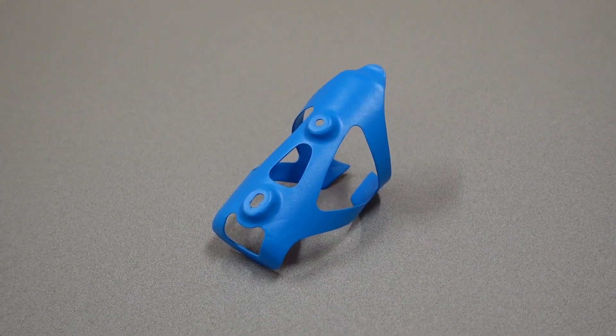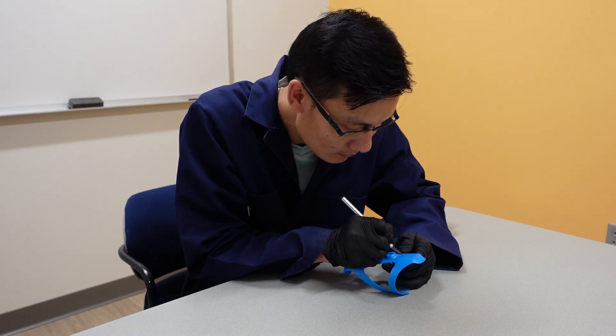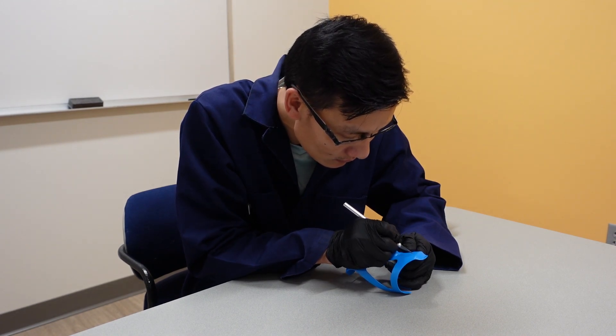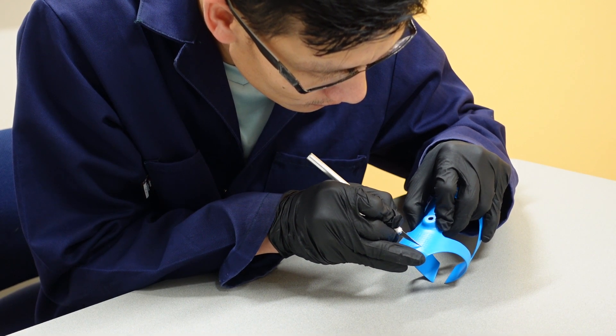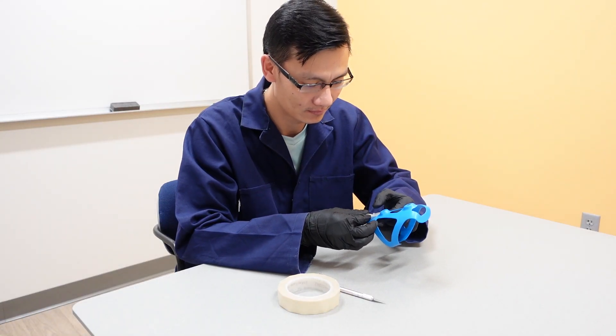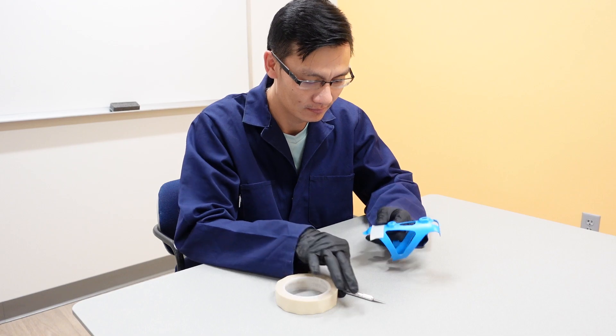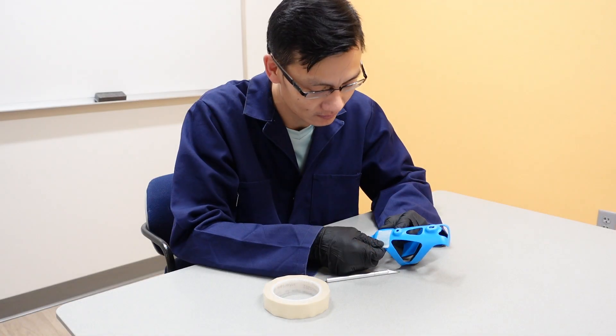The result is a durable UV-cured powder coated finish. Hip is now going to test adhesion. ASTM D3359 is the standard method to measure and classify adhesion of a coating material to a substrate. The coating is cross-cut scribed at specified spacing using a knife, and then pressure-sensitive tape is applied over the scribed area and pulled off sharply.